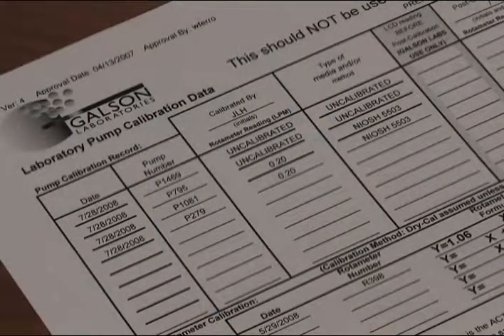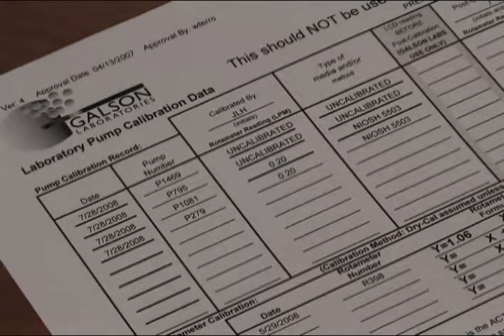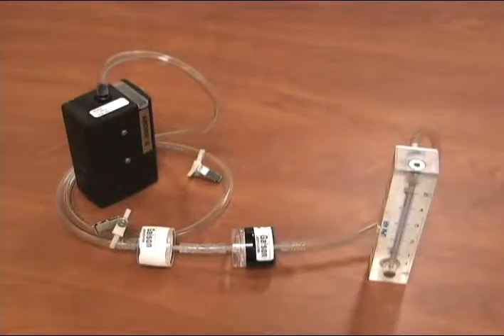All pumps have the lab calibration information on the pump calibration data sheets provided. Set up the pumps with the correct media in line with the field rotometer as shown.